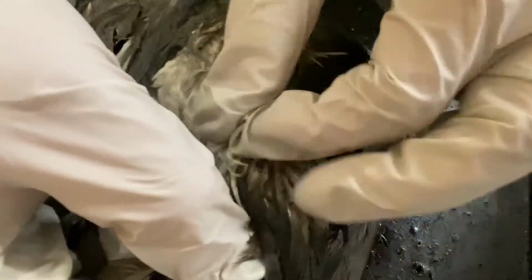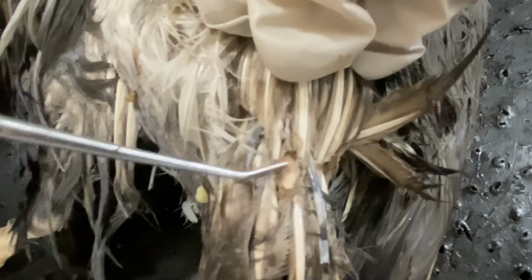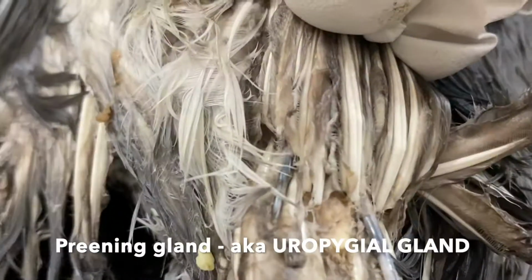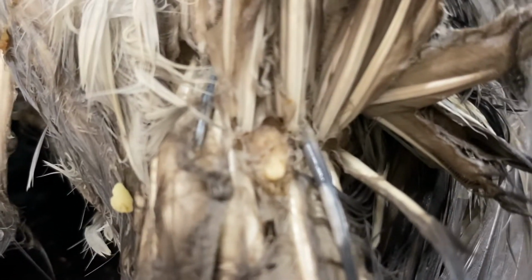But if I pick up the contour feathers and the downy feathers, we'll see right there that triangular structure. Right here is the preening gland. And so they're going to pick up oil from there, and they're going to rub it around their feathers to help them preen, and to stay warm.